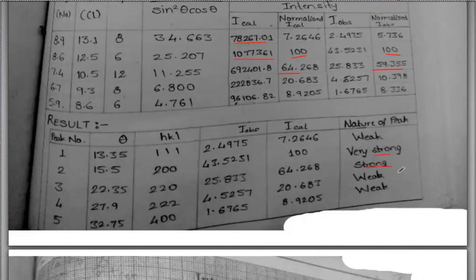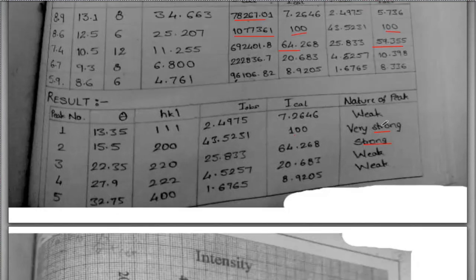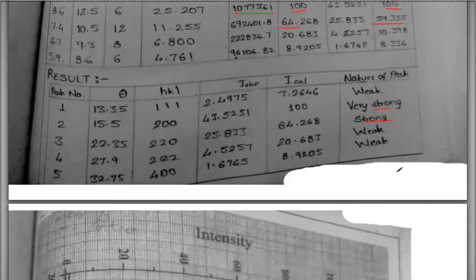So the way you have grading, O grade, A grade, B grade, scale it on that particular percentage pattern, and then you can say certain peaks are very weak. The intensity is very low. So maybe 35% or 40%, below that you can say weak, or below 20%, you may have weak intensities and all these things. Okay, so this is part of your comment.